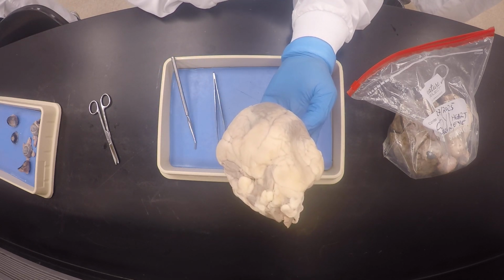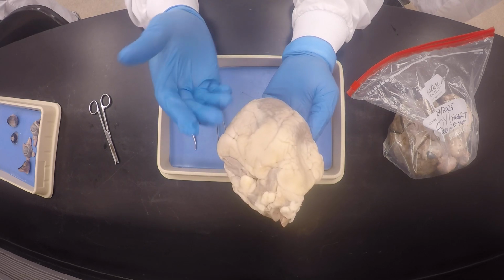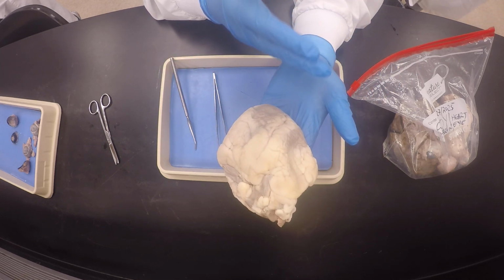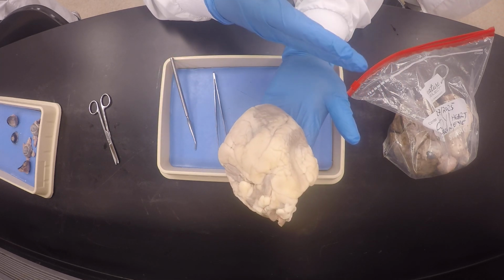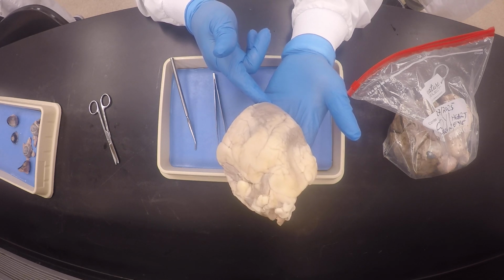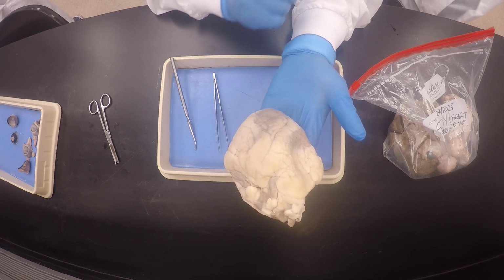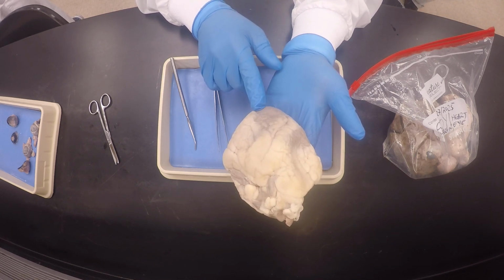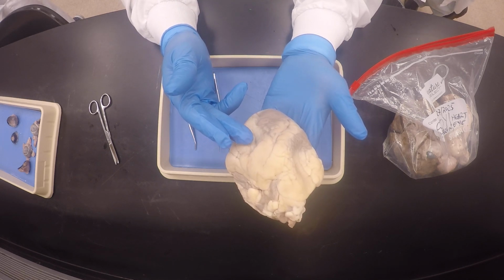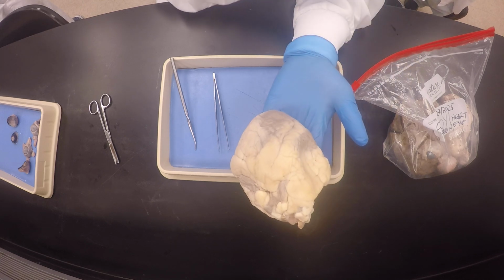Okay? All right? And then we will know that the left ventricle includes the apex. So even when we cut through and open it, we can always tell which one is the right ventricle. One, because it's smaller, but two, because the apex is always on the left. It's not equal. If it was divided equally, both of them would have a bit of the apex. But the apex is on the left. So whenever you see the apex and I ask what's that chamber, you know it's going to be the left ventricle. And then this will be the right ventricle.